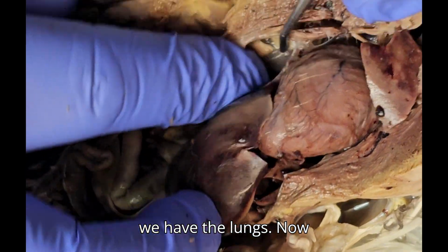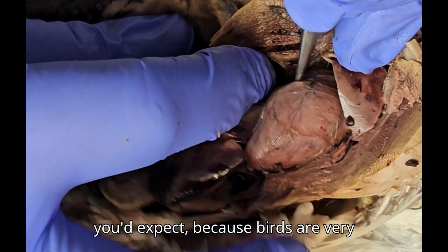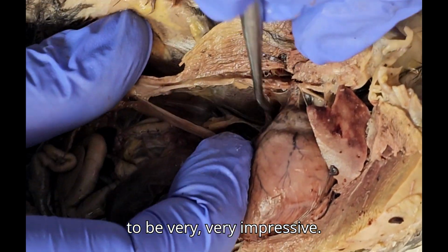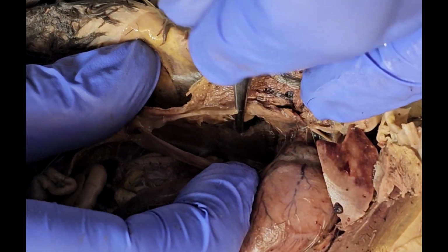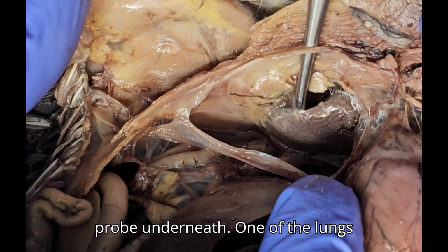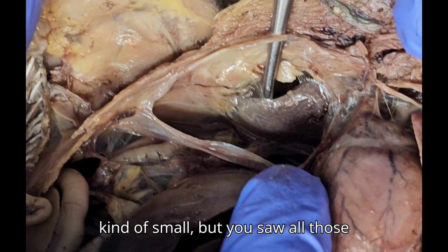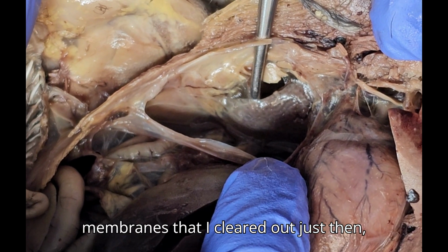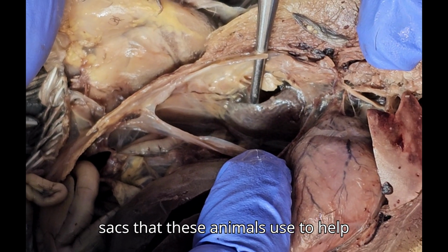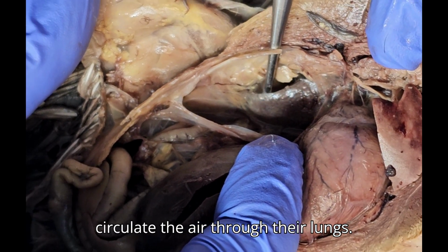And we have the lungs. Now you'd expect, because birds are very aerobic animals, that the lungs are going to be very impressive, but frankly they're not. There I have my probe underneath one of the lungs. Kind of small, but you saw all those membranes that I cleared out just then, and those membranes were air sacs that these animals use to help circulate the air through their lungs.